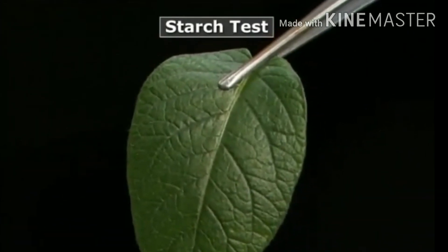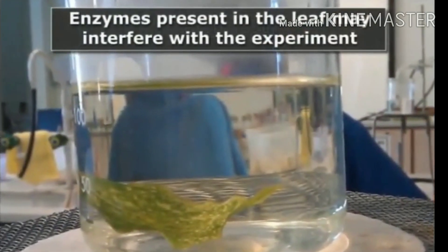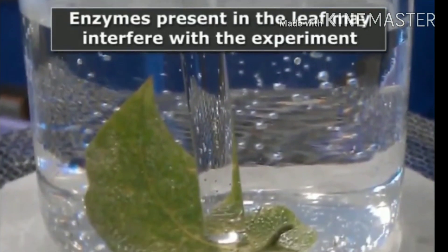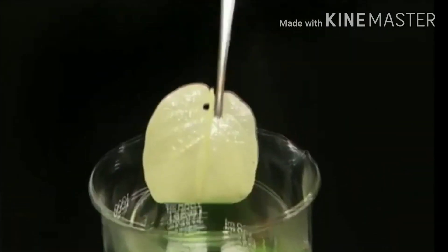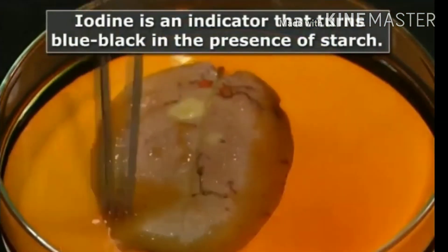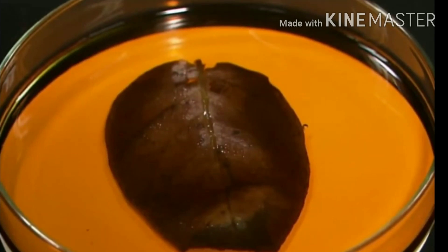Now let us see the video of the starch test. Take a healthy leaf from a potted plant growing in sunlight and put it in boiling water for about 30 seconds so that the cells are killed and enzymatic and biochemical reactions are stopped. After that, place the leaf in warm ethyl alcohol so that the chlorophyll is dissolved and the leaf turns white. Then take the decolorized leaf and put it in iodine solution in a petri dish. After some time, the leaf changes into bluish-black color, as shown in the video, indicating that starch has been prepared by the leaf.